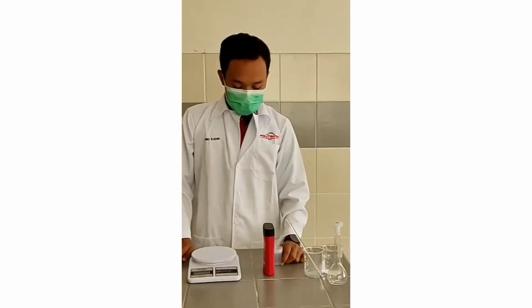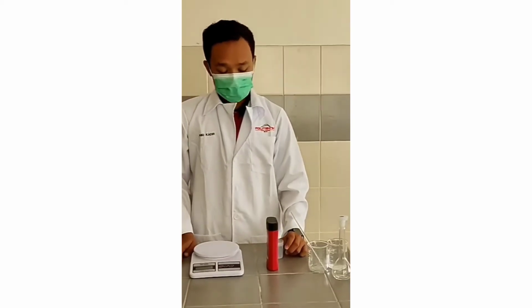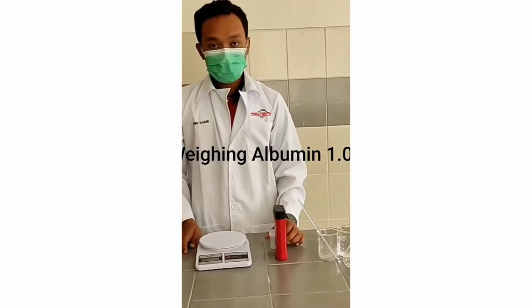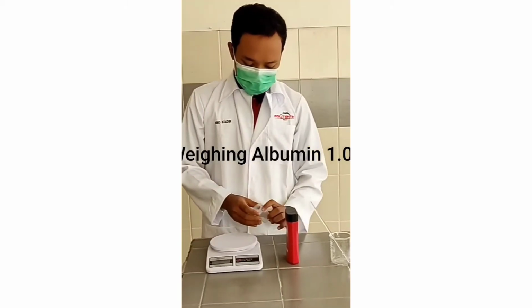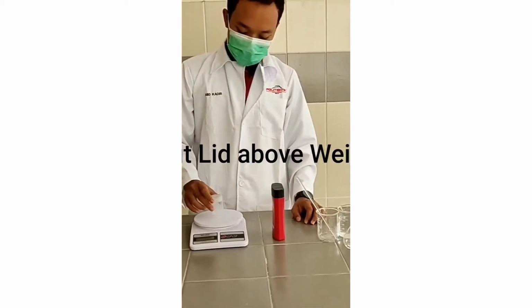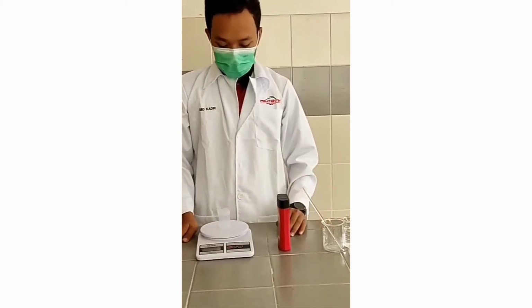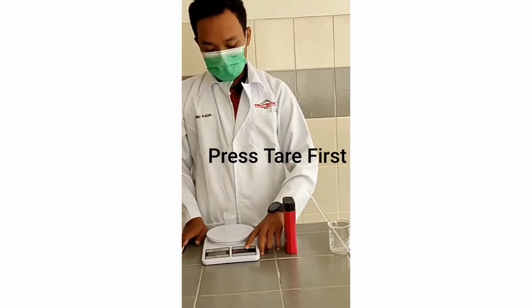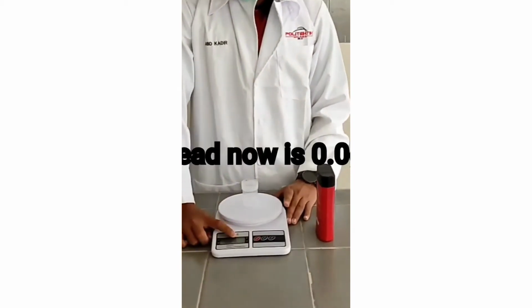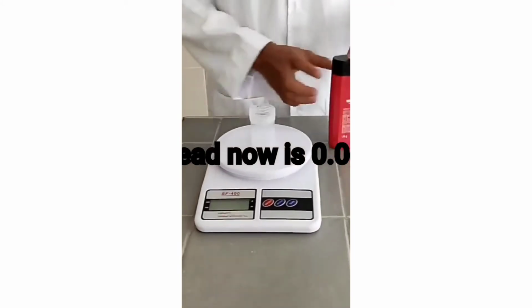Okay, now we will weigh the albumin solid. We will put the lid on the electronic balance and we must press the tare first. Okay, now the electronic balance reads 0.0 gram.